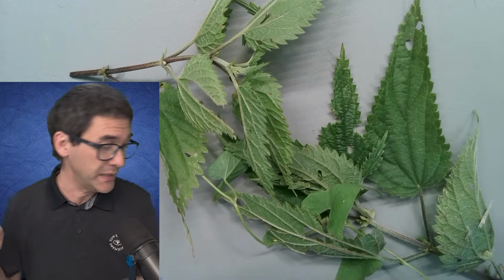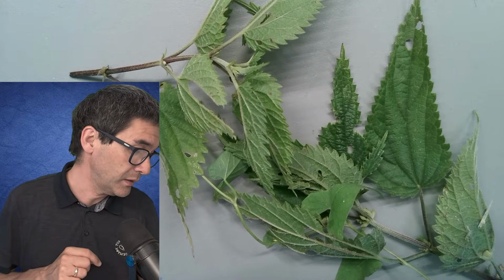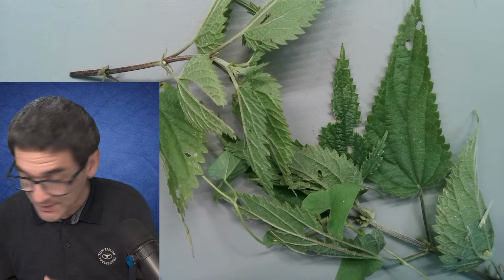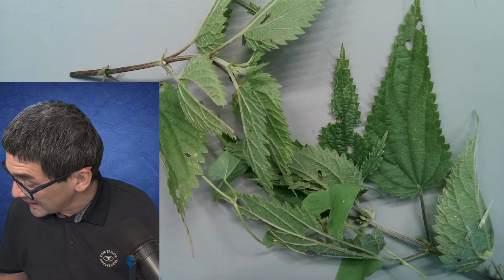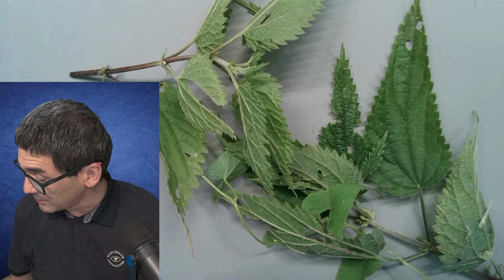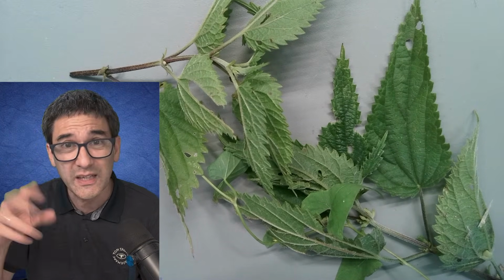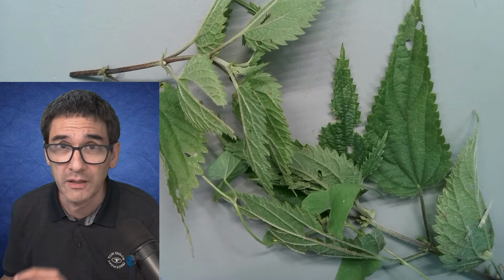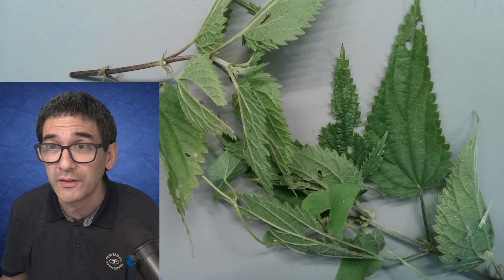I want to, again, put the water sample with the ciliates that I've got over here under the microscope to see how that sample has developed. And we're going to look at a few slides that we prepared 2 weeks ago to see how they are actually looking, because their quality has degraded a little bit. So for this reason, I'm going to do a collection of a variety of different things.